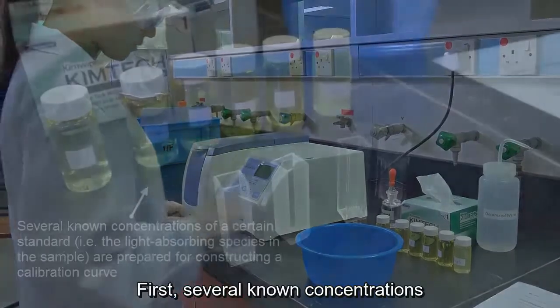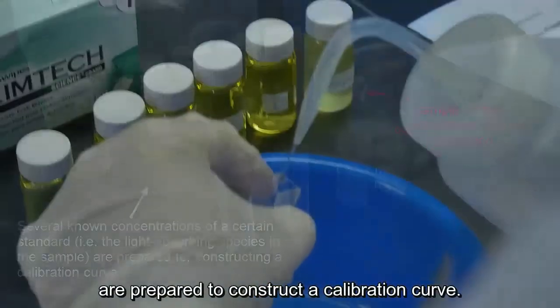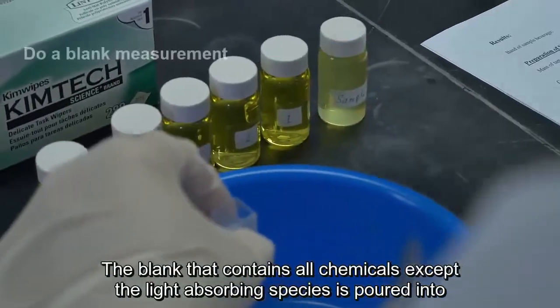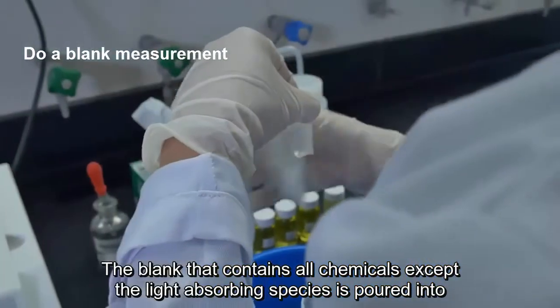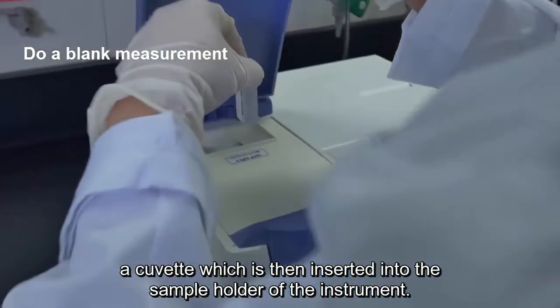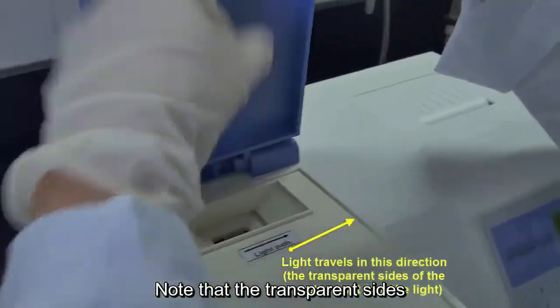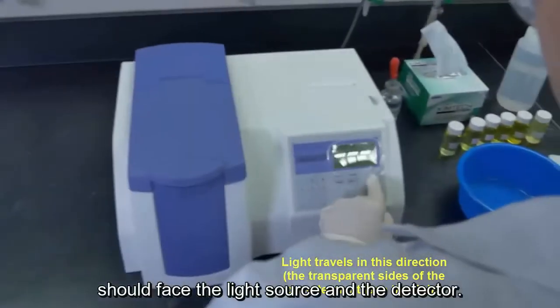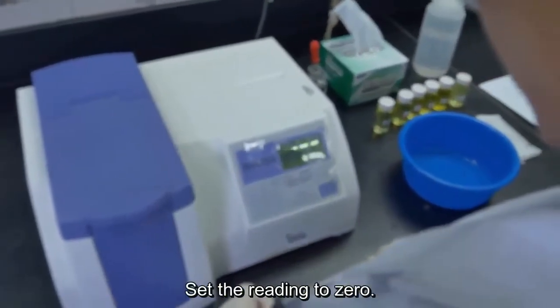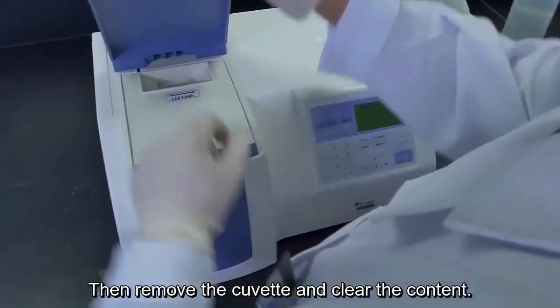First, several known concentrations of a certain standard are prepared to construct a calibration curve. The blank that contains all chemicals except the light-absorbing species is poured into a cuvette, which is then inserted into the sample holder of the instrument. Note that the transparent side of the cuvette should face the light source and the detector. Set the reading to 0, then remove the cuvette and clear the content.